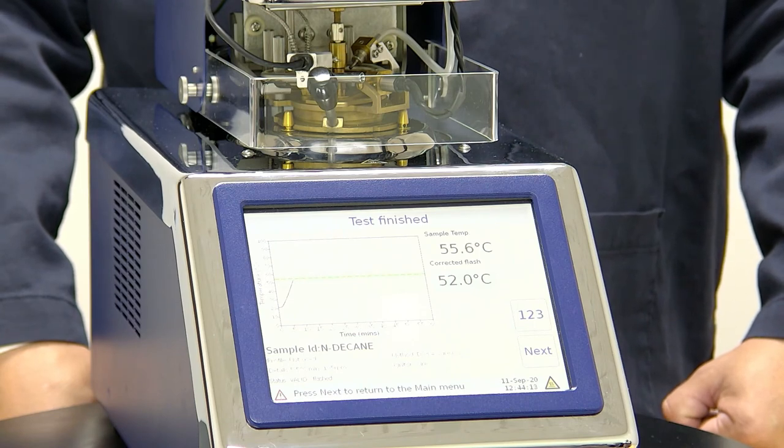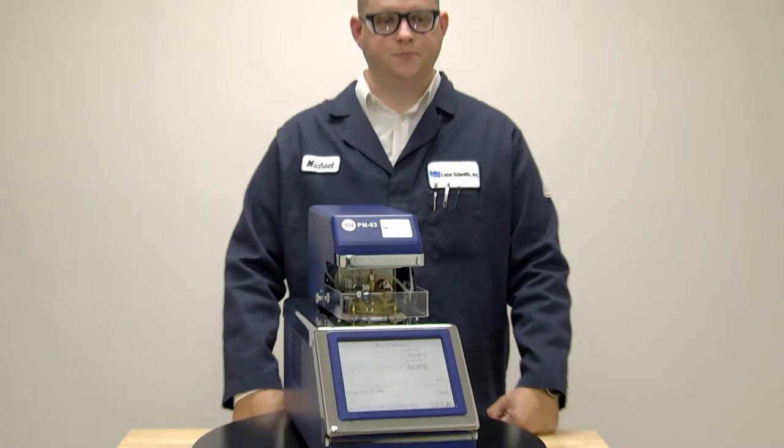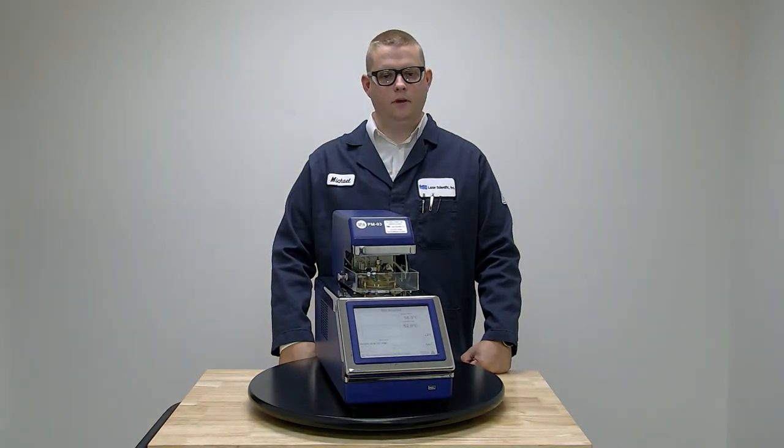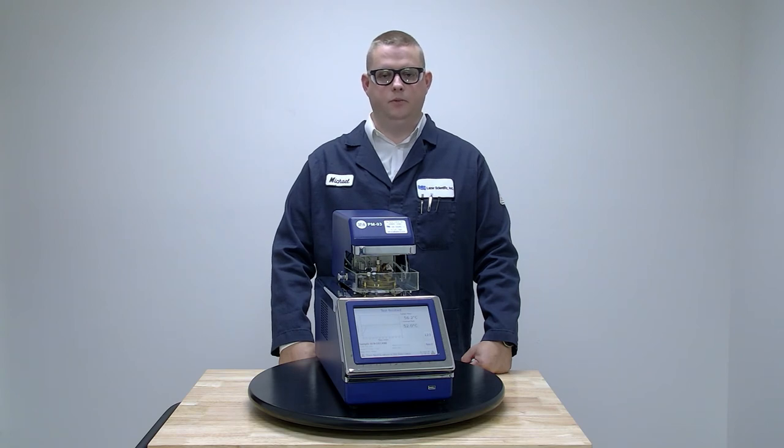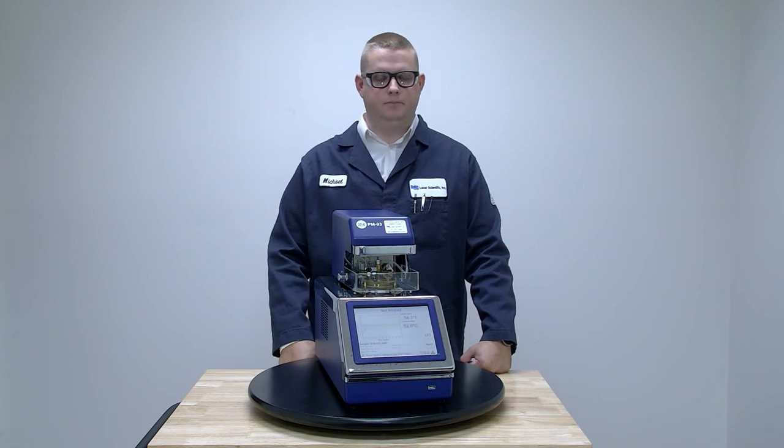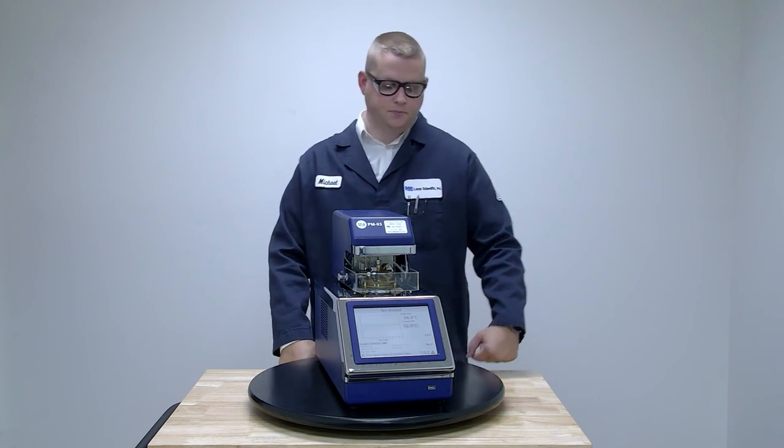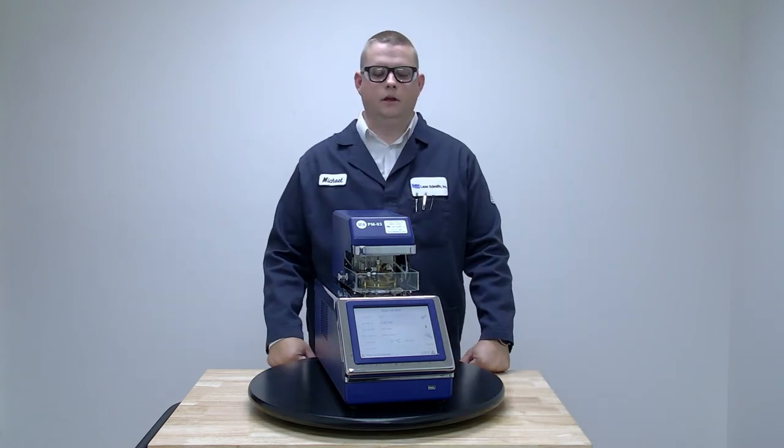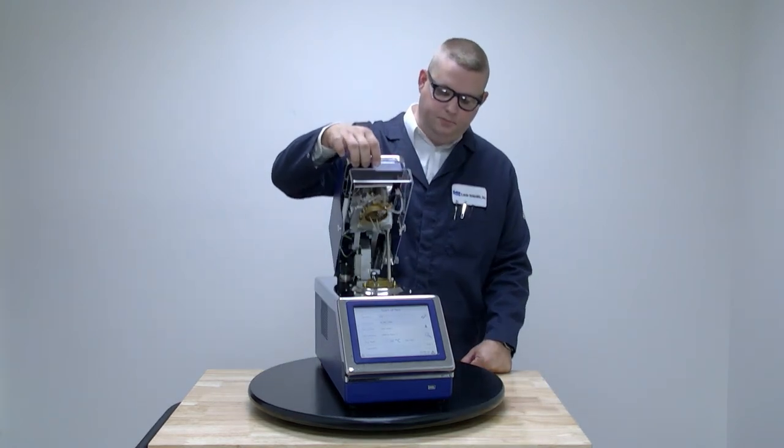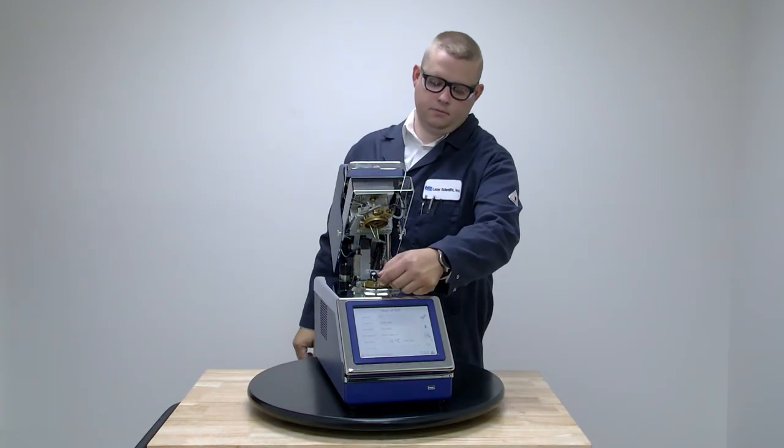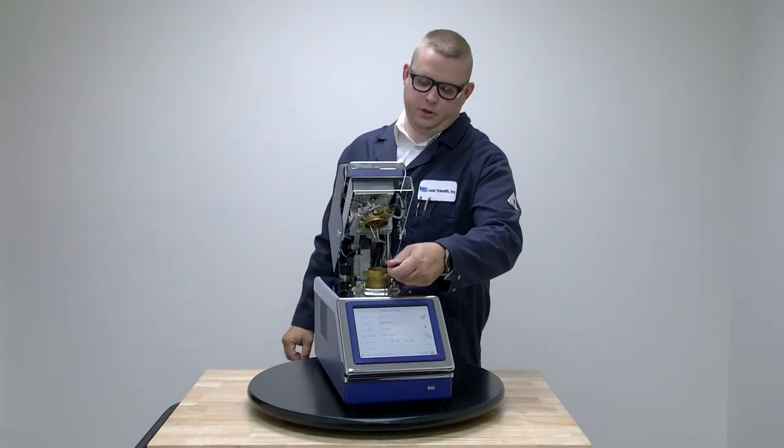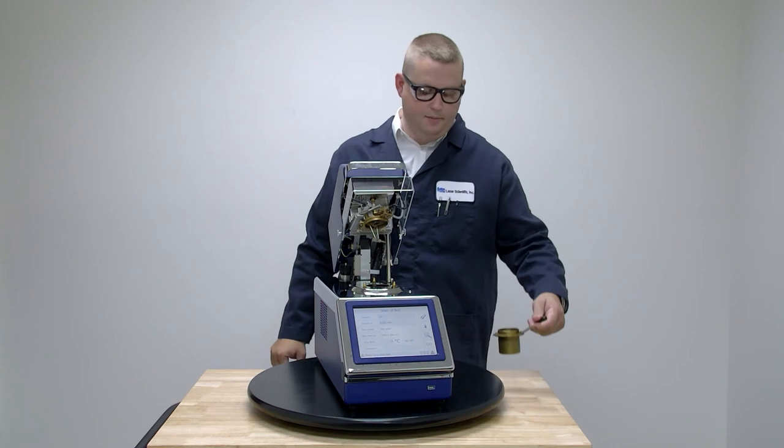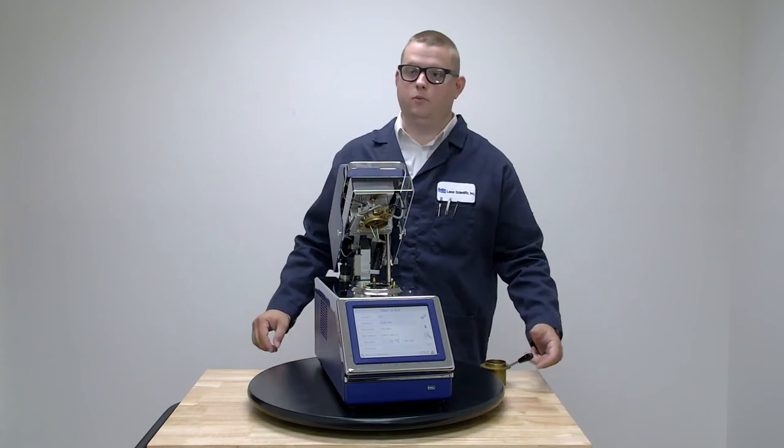At this point the test is done and the instrument will start cooling down. Once the instrument has cooled down, the cooling fan will turn off and you're ready to go. At any point, we can press next to get back to our main menu. And you can now lift the pot up, remove and properly dispose of your sample in accordance with your laboratory procedure and you're ready for your next test.